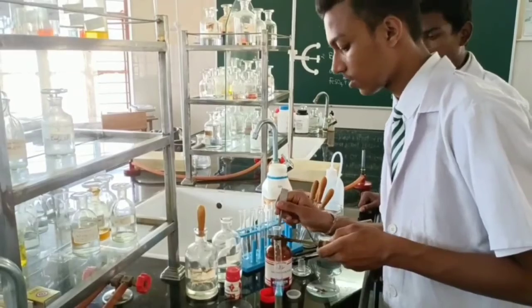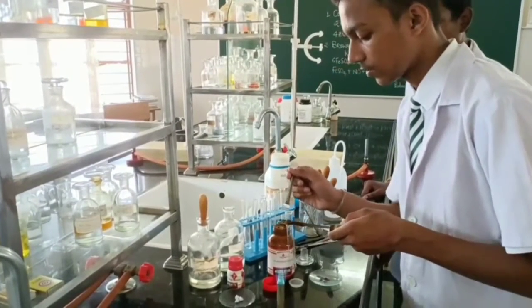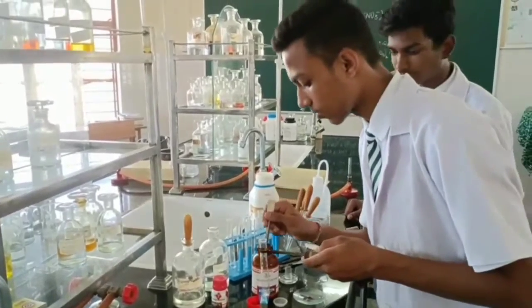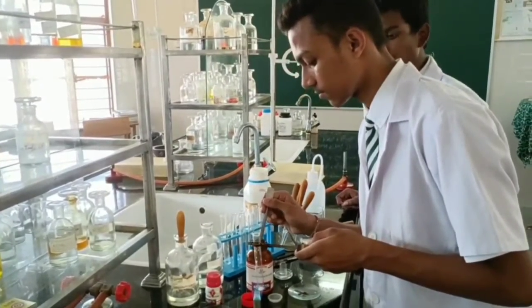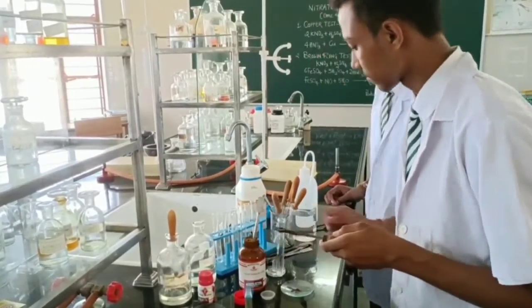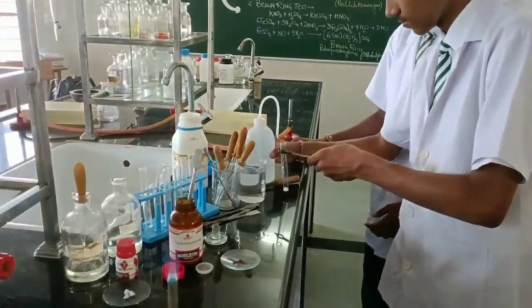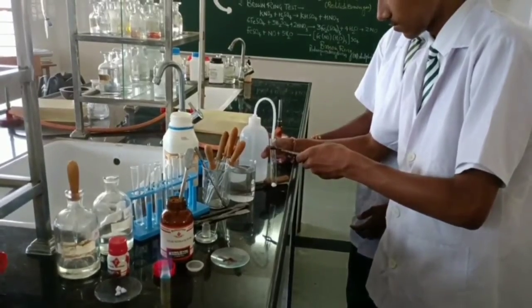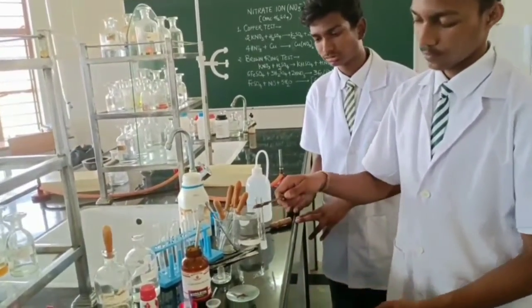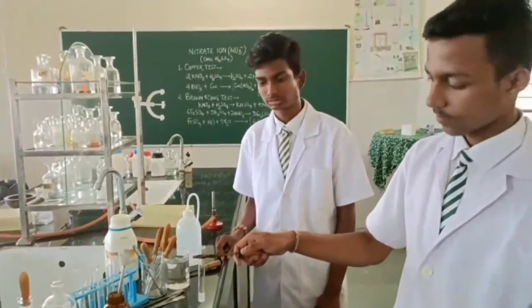I'm going to add some salt. Yes, aqueous solution I have to prepare. Yes, aqueous solution means salt plus water. That is also called the original solution of salt, right? Yes. Original or aqueous solution of salt means you have to take a little quantity of salt, a pinch of salt, and then some quantity of distilled water or plain water, whatever. Tilak has prepared the aqueous solution of the salt, which was given for the testing.